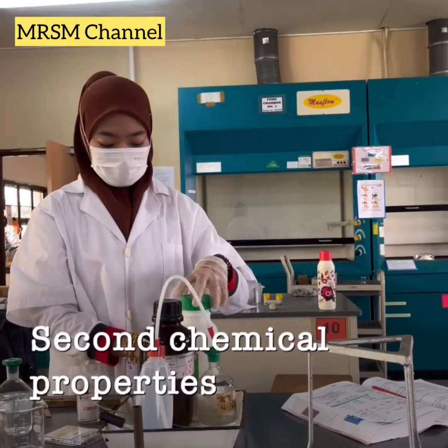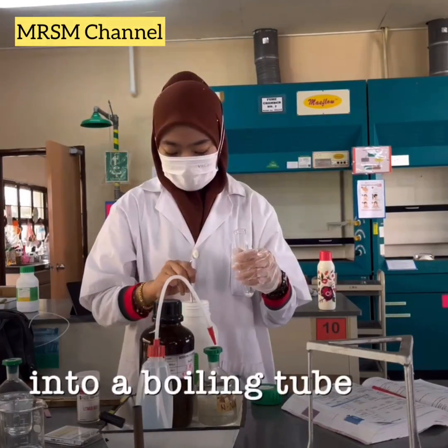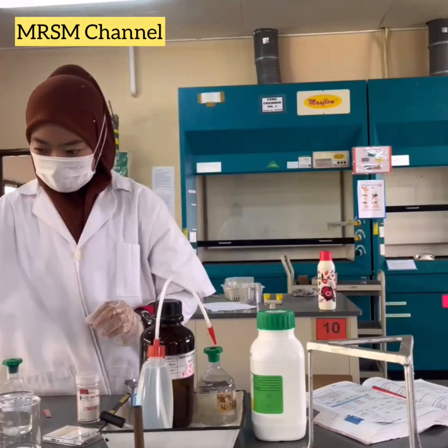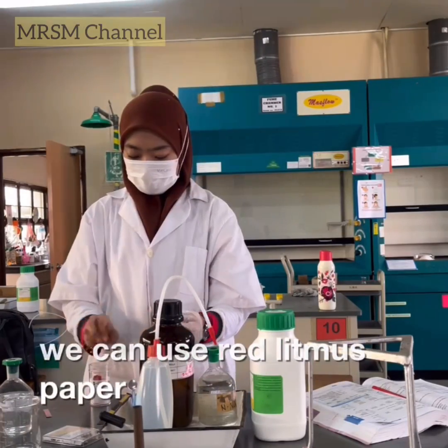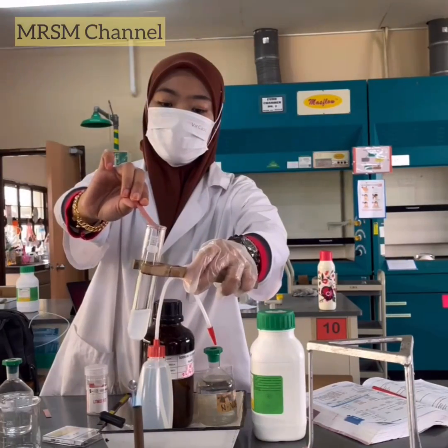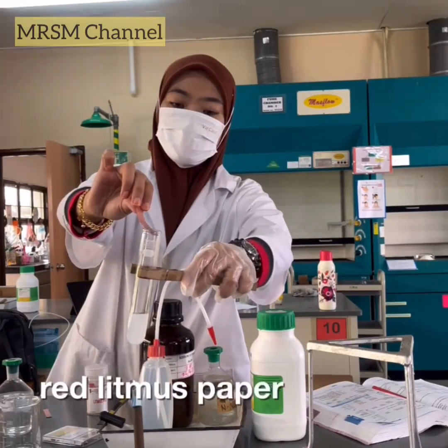Second chemical properties. Add two spatulas of ammonium chloride into a boiling tube. Pour calcium hydroxide solution into the boiling tube. We can use red litmus paper to test the ammonia gas. Heat the mixture. The observation is that the red litmus paper will turn blue.